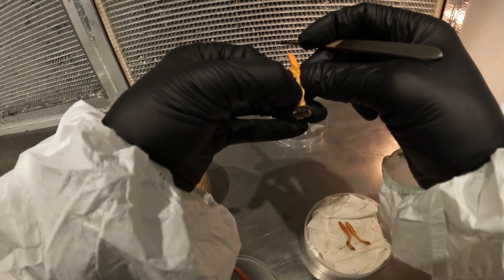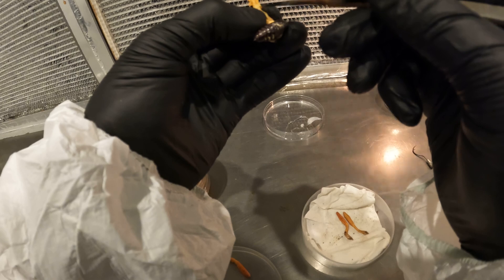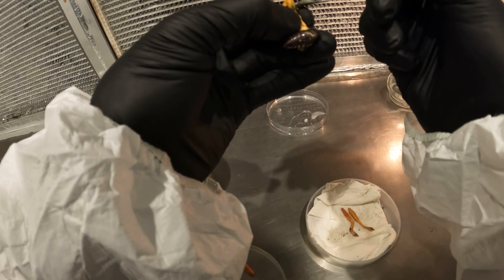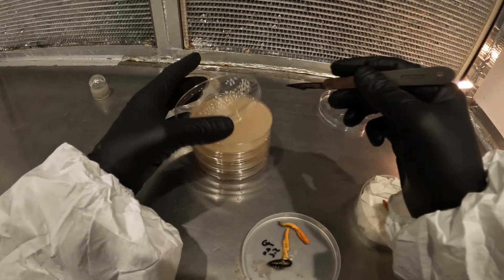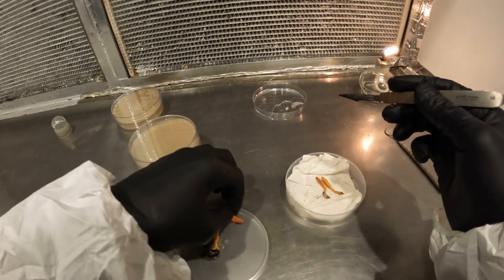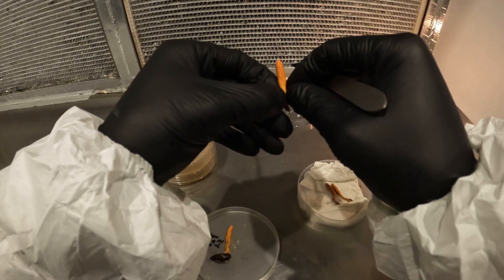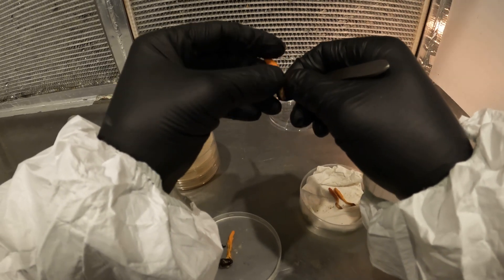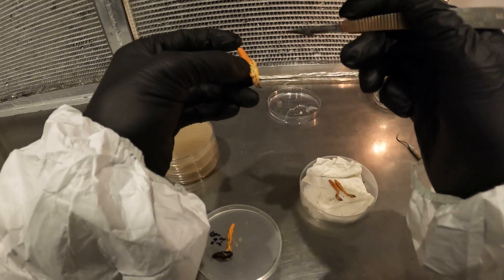I would imagine these are going to be some dirty samples, but it's just difficult when the specimens are so tiny. I'll still try to get a clean sample from the middle tissue and not the outside tissue. Now I basically repeat the process. I have a lot of luck finding these in the mountains — the mountains of the western Carolinas, whether in South Carolina or North Carolina, Cordyceps militaris is out there and I find it easily.